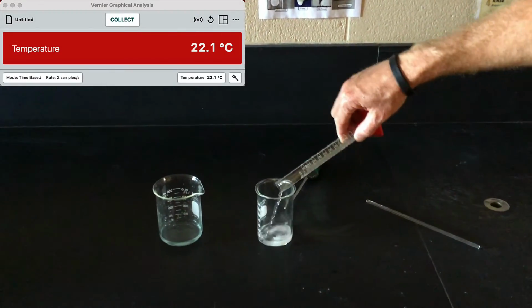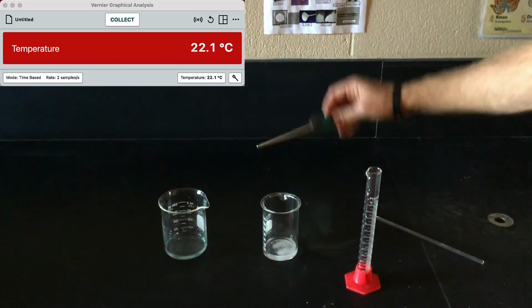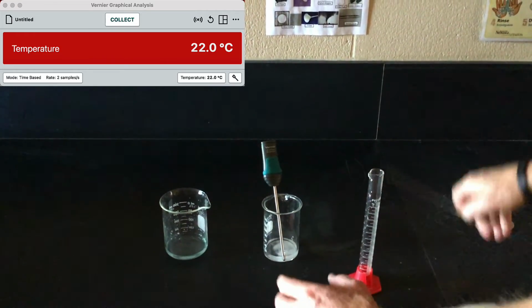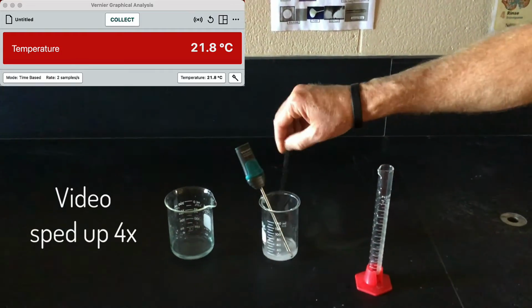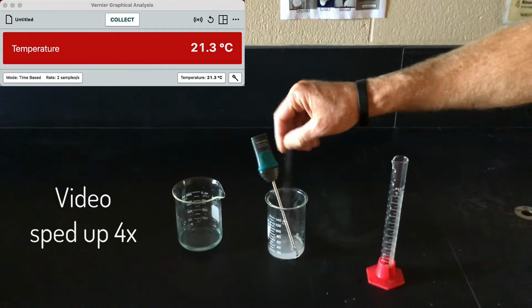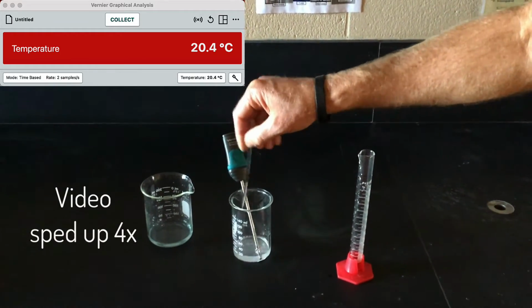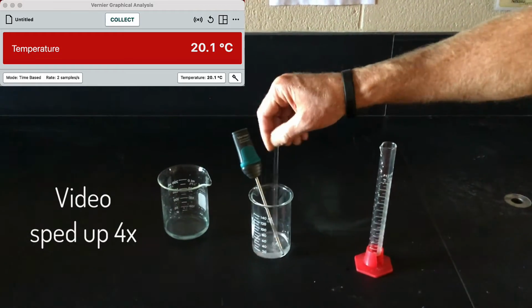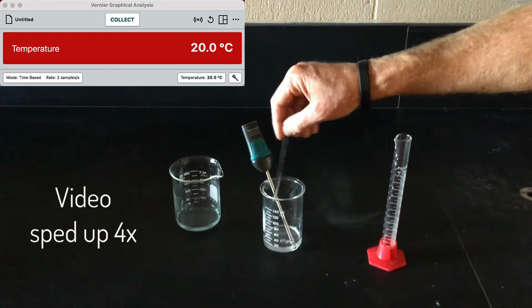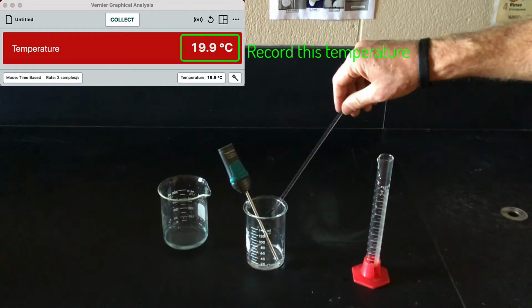Now add 15 milliliters of distilled water to the sodium chloride and stir it up to dissolve all of the salt. When you do this, record the temperature using the temperature probe. Make sure to record the final temperature in the data table at the bottom of page 6, where it says temperature of NaCl in 150 milliliter beaker.